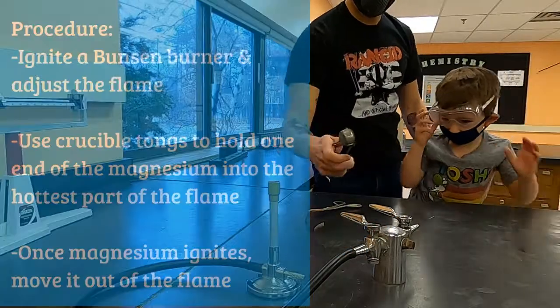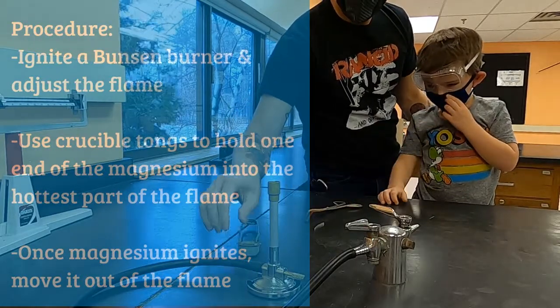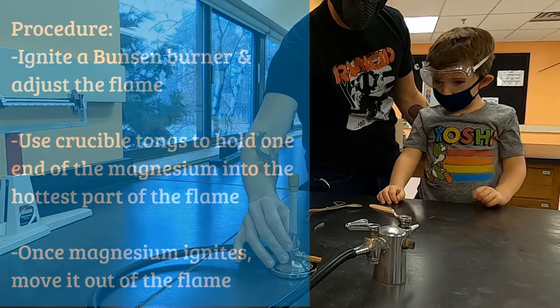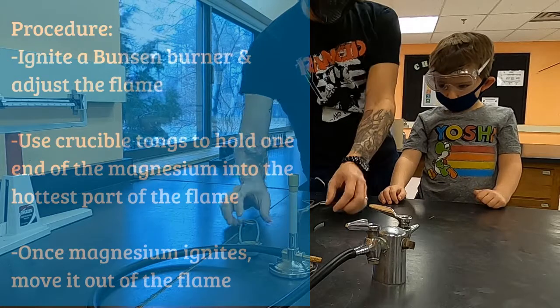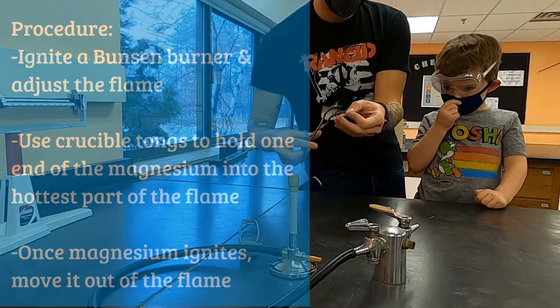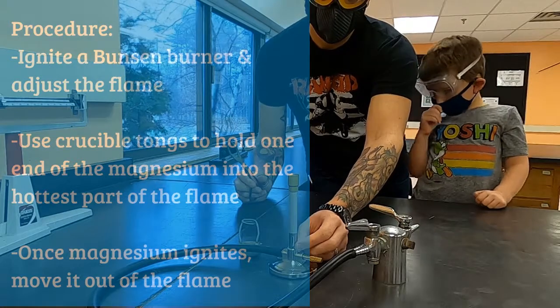So for this, what you're going to be doing is using the flame from a Bunsen burner to ignite some magnesium ribbon so that it will react with the oxygen that is in the air. It is not reacting with the methane that's coming out of the faucet. It's reacting with the oxygen gas that's in the air.